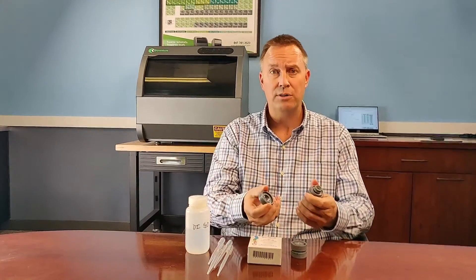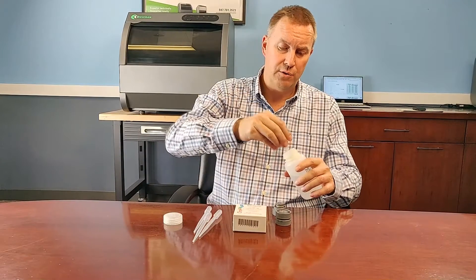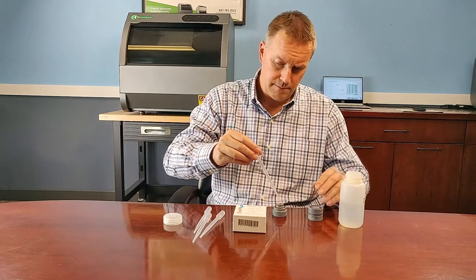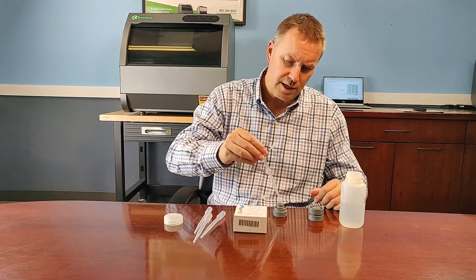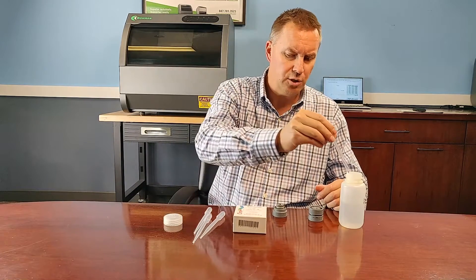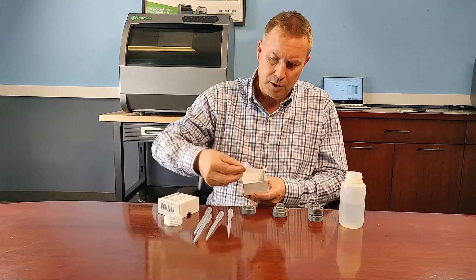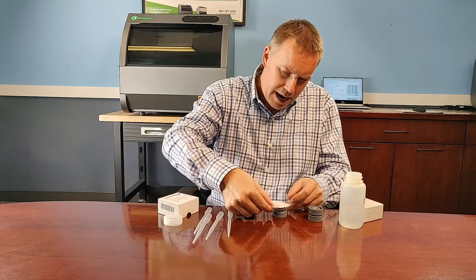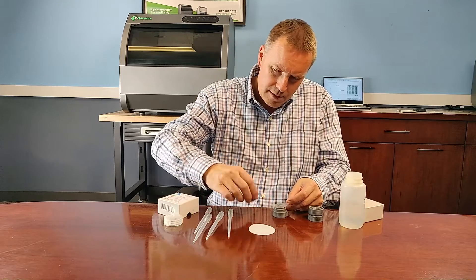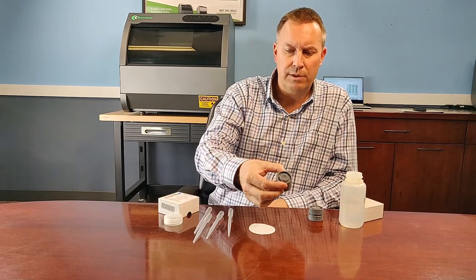So to actually put all that together, it's easy — I'll show you how. You just pull apart your sample cup, place a few drops of your solution into the cup, and you create sort of a reverse meniscus. The design of this cup has a little reservoir for overflow if you put too much in there, so it won't drip outside of the cup. Then you just use one of these pre-cut films, which have a little piece of paper on there to help control the static. You just lay that on top, remove the paper, and pop the top on — now you've got a closed cup with a consistent volume in there.